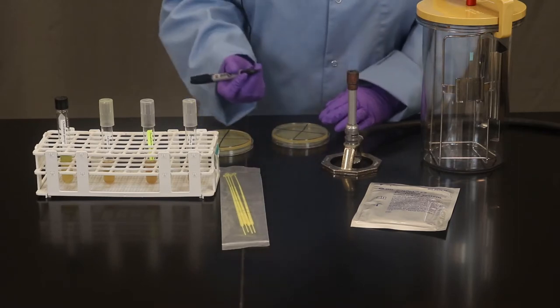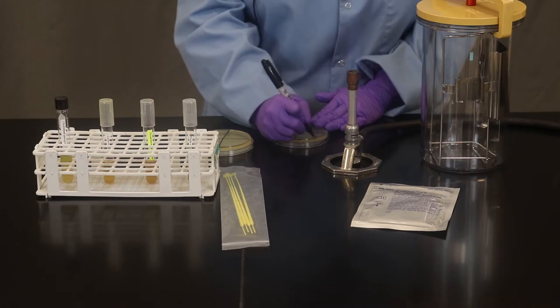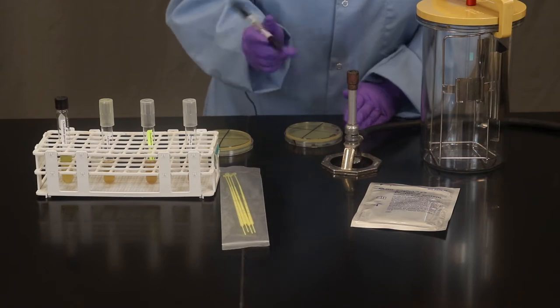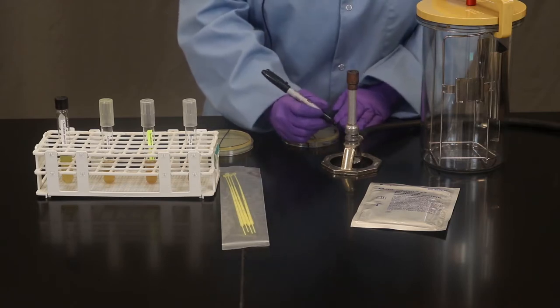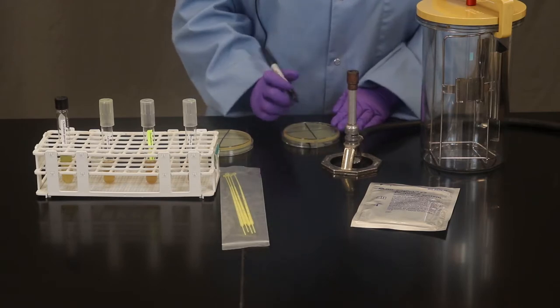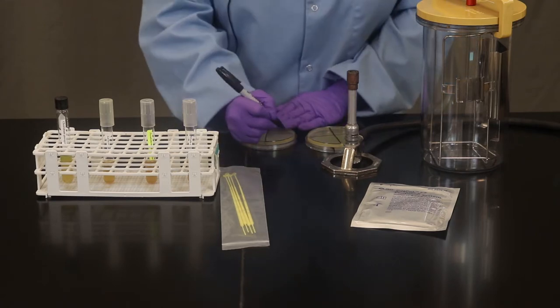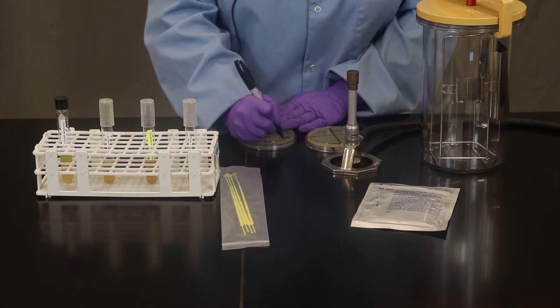I'm going to indicate your initials here, your date, the type of agar, the BHI as a reminder here. And this time we're going to indicate air on one plate, and on the other plate we're going to indicate anaerobic.